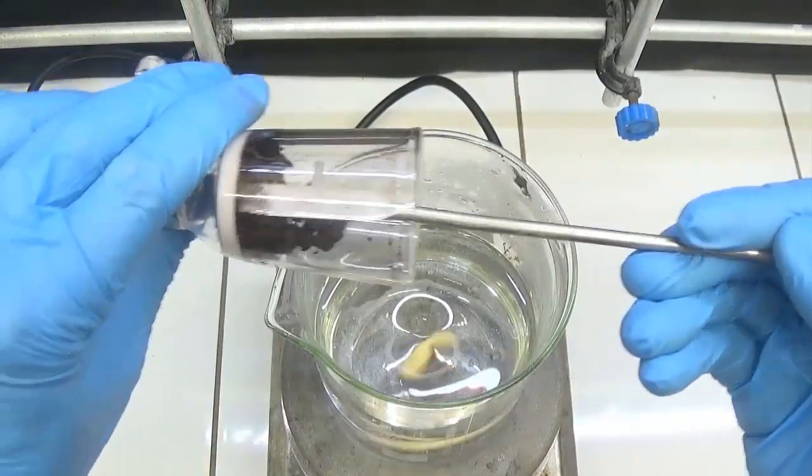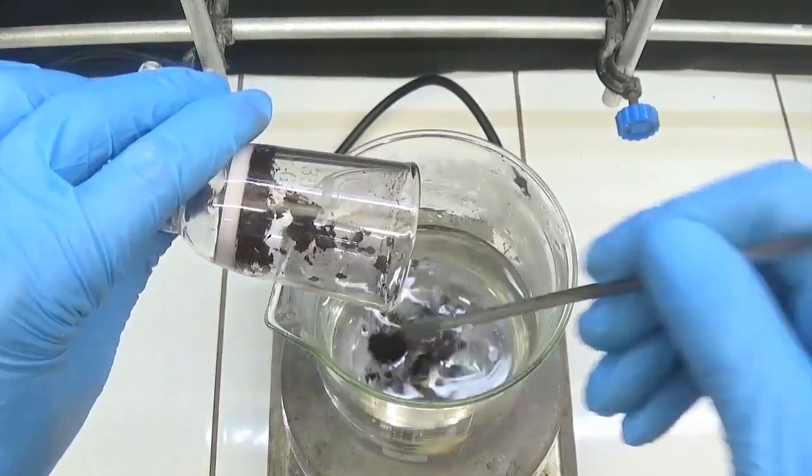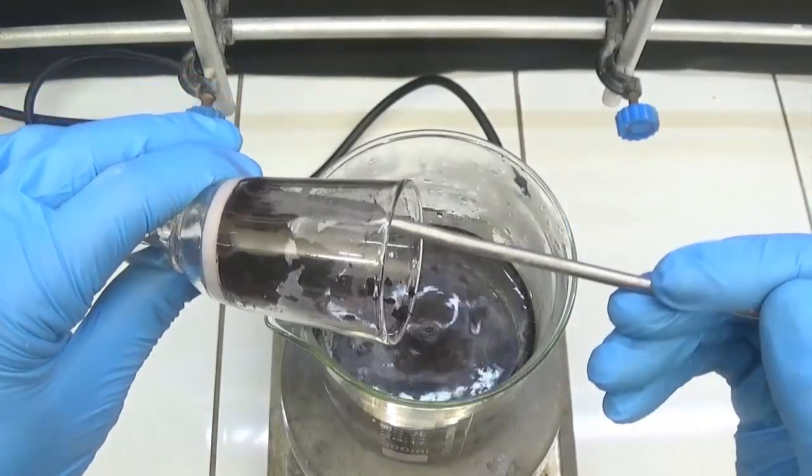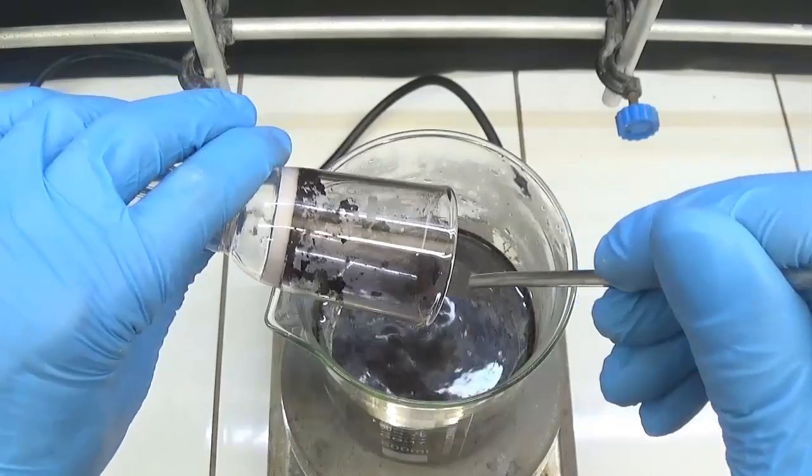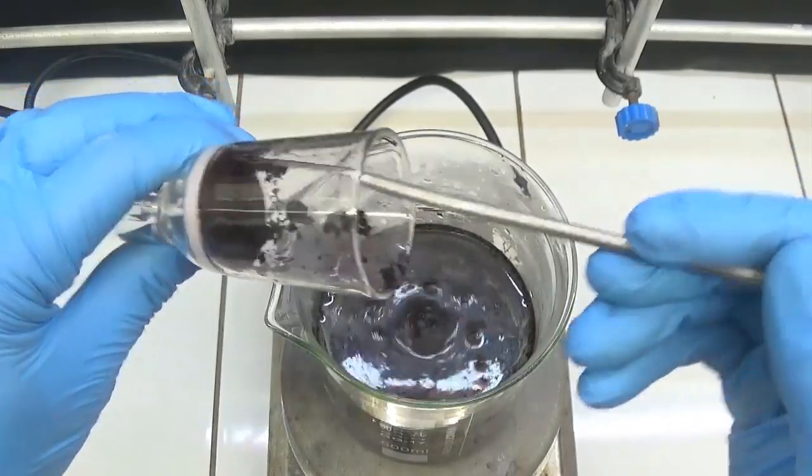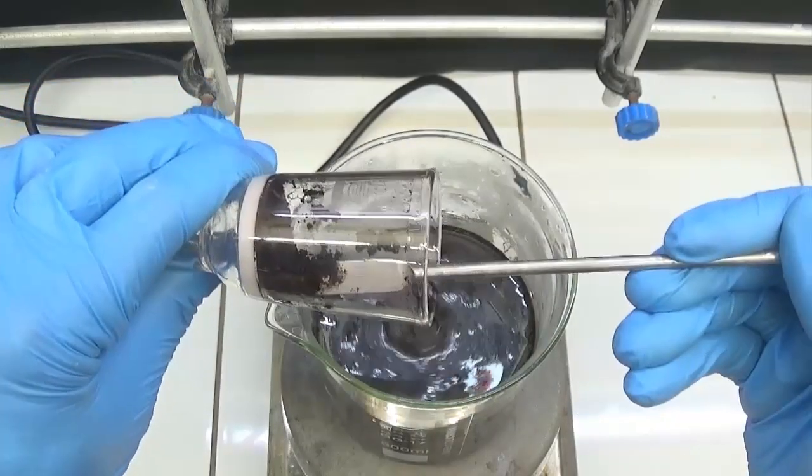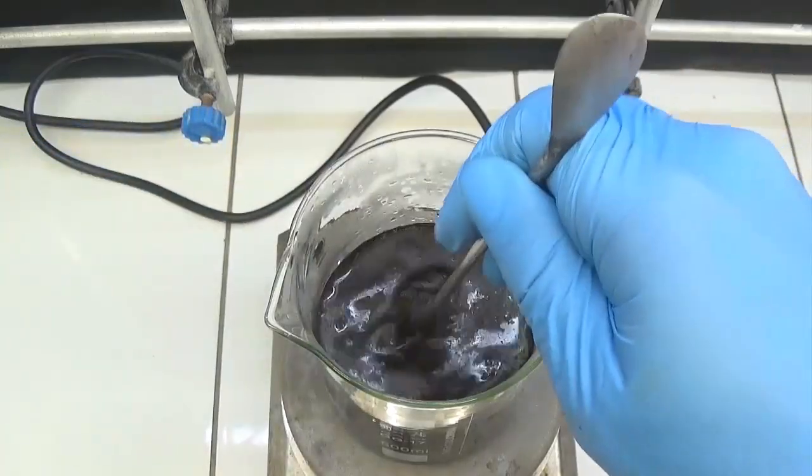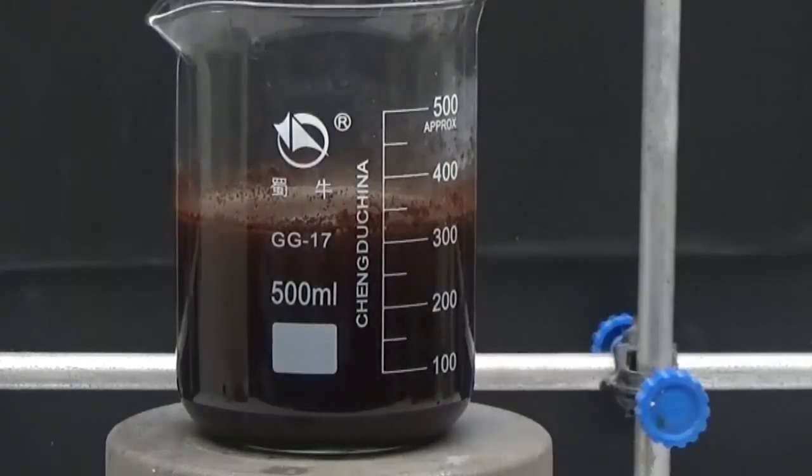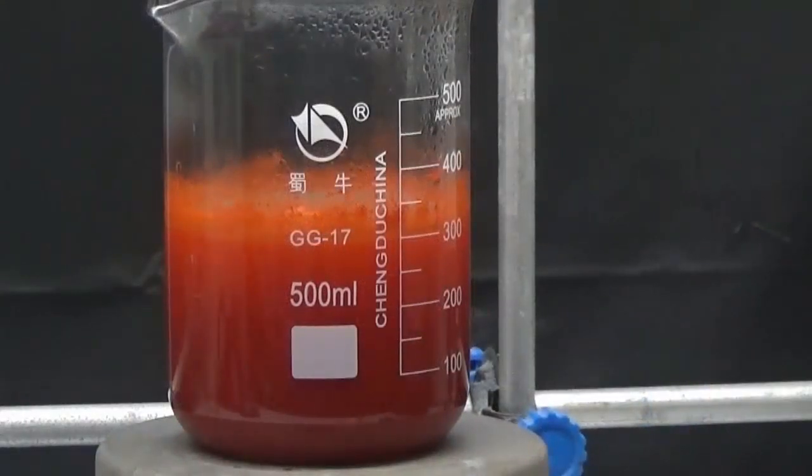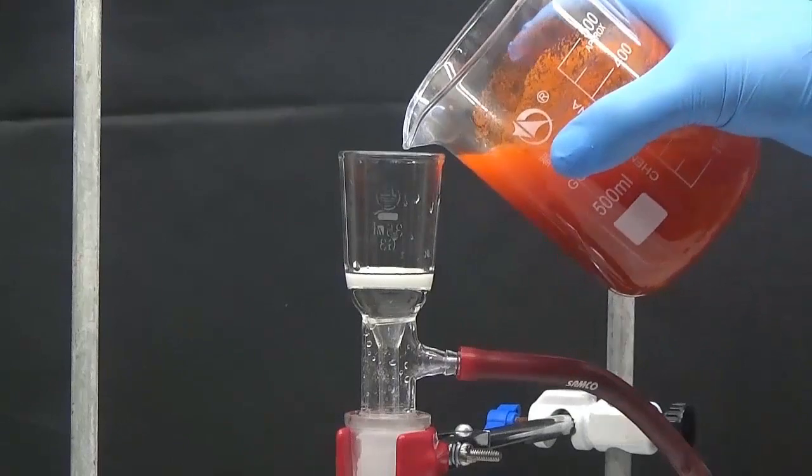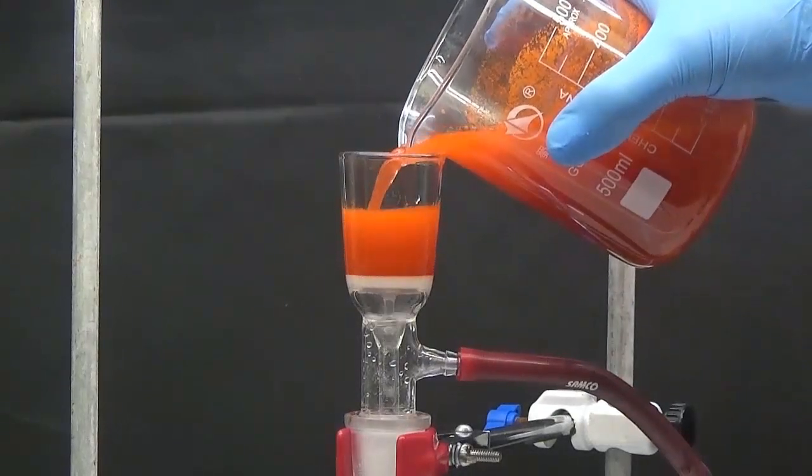The solid is dispersed and boiled in 300 milliliters of 5% hydrochloric acid where pure quinizarin is released. It is collected by filtering and washed using distilled water.